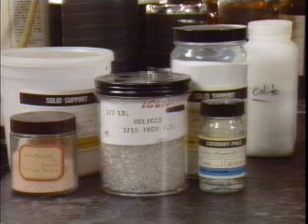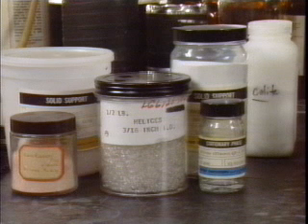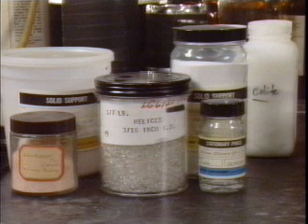So that a large surface area of the stationary phase can be exposed to the vaporized molecules of the mixture, the liquid stationary phase is thinly coated on small inert solid particles called the support. The solid particles are commonly glass or diatomaceous earth.